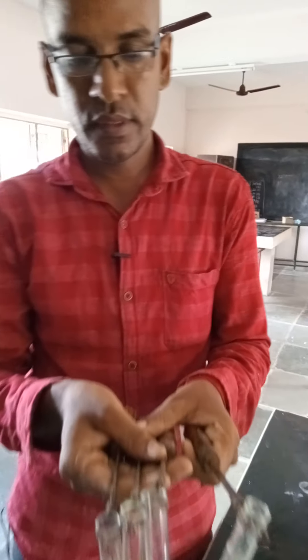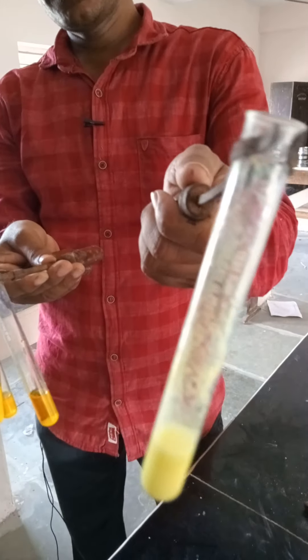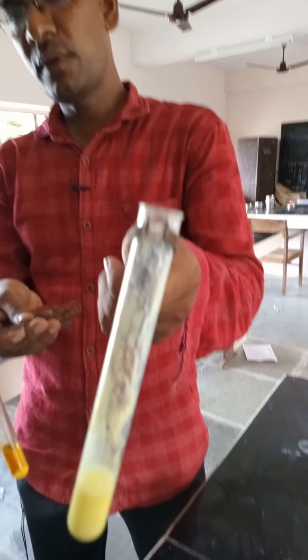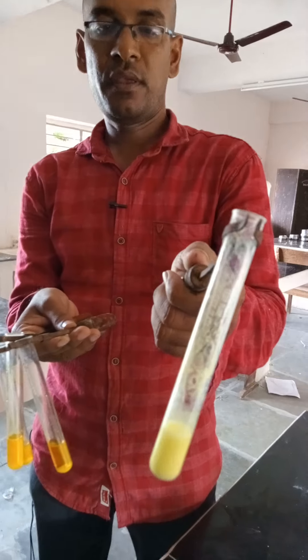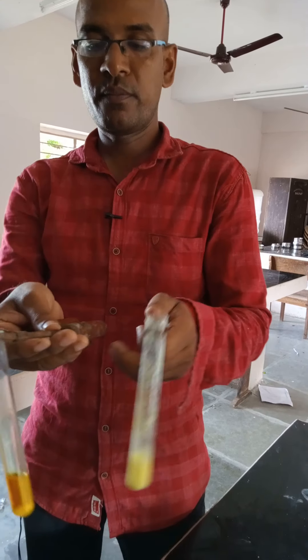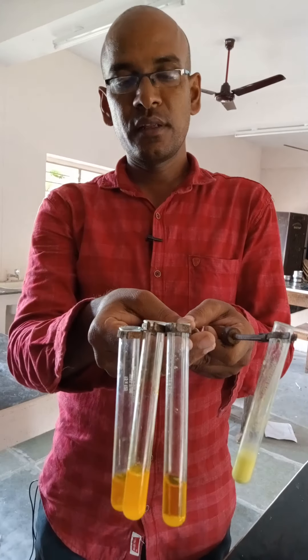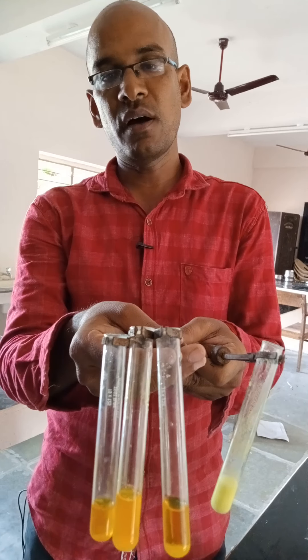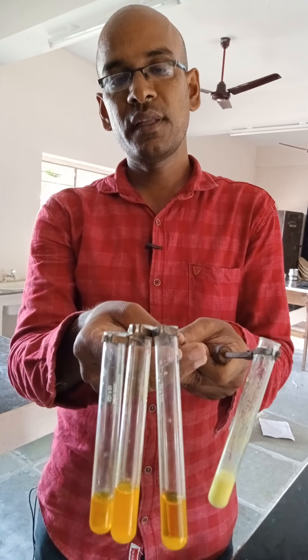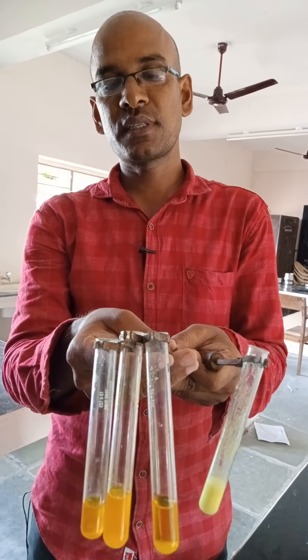In the first test tube, yellow color precipitate is formed, indicating confirmation of barium. In the other three test tubes, no yellow color precipitate is formed, indicating absence of barium. Thank you very much.